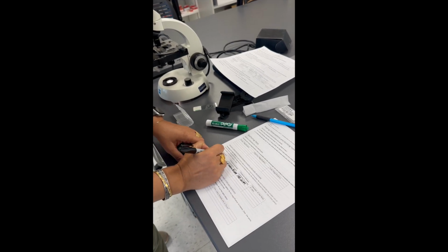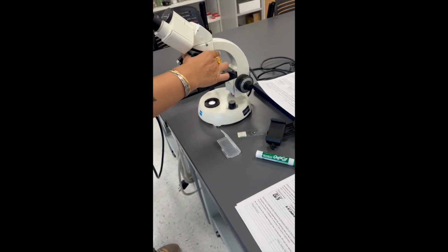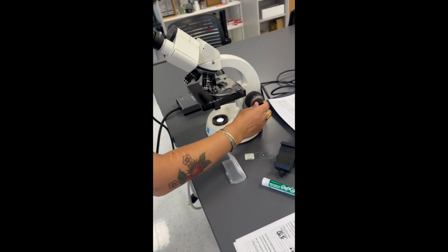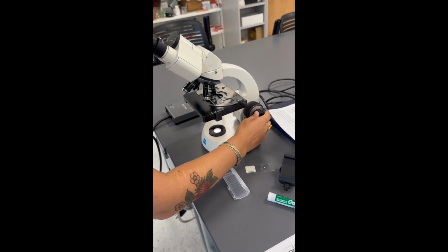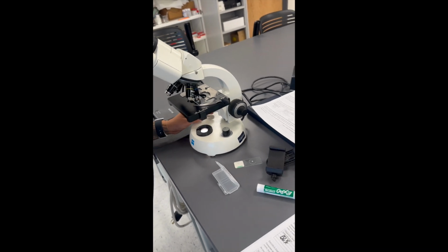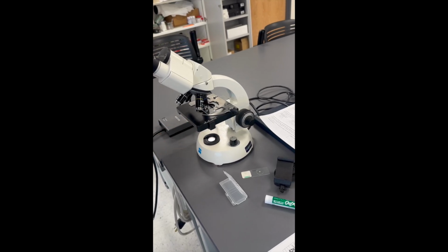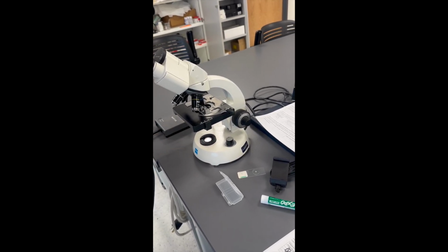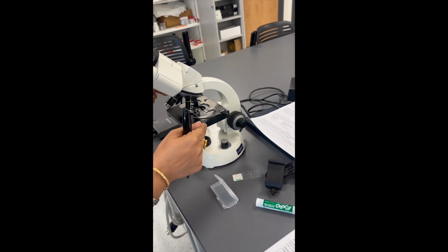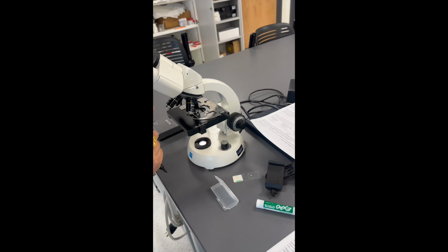Okay. So next I want to look at the distance between individual tick marks and the distance between numbered tick marks at 40x. So I'm going to change my objective lens to 40x, and I'm going to take a look and see how my ocular micrometer and my stage micrometer line up. So I'm gonna just shift my stage micrometer just a bit so that numbers are lined up exactly. And what I see is between two numbered tick marks on the stage micrometer, the ocular micrometer goes from 1 to 9.